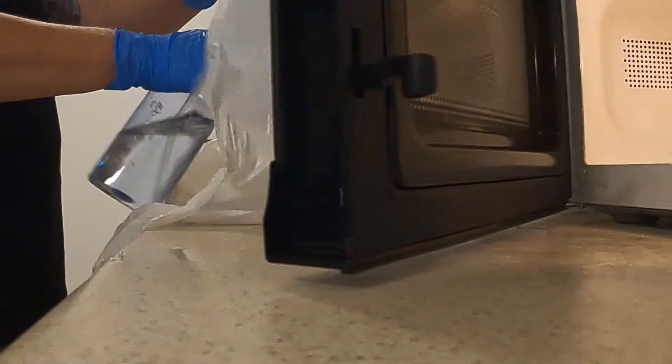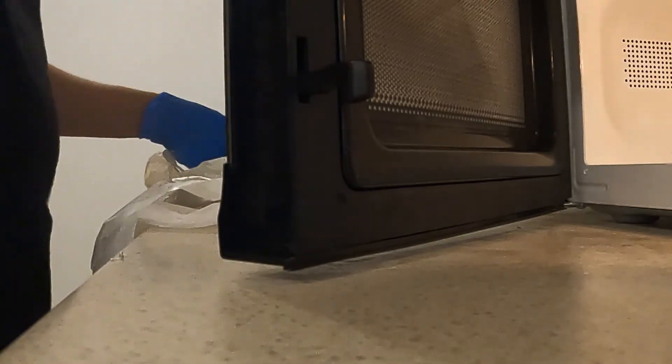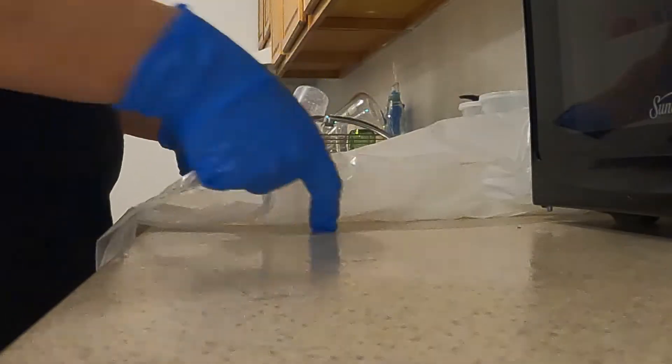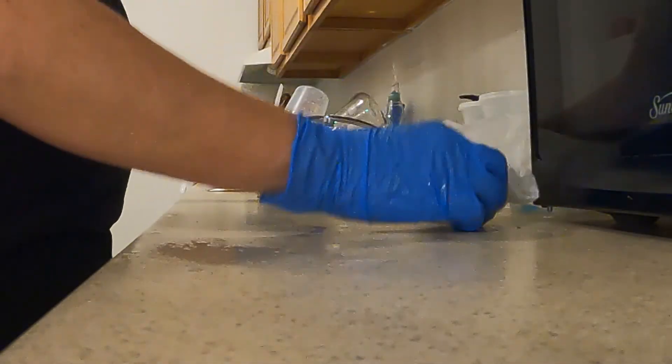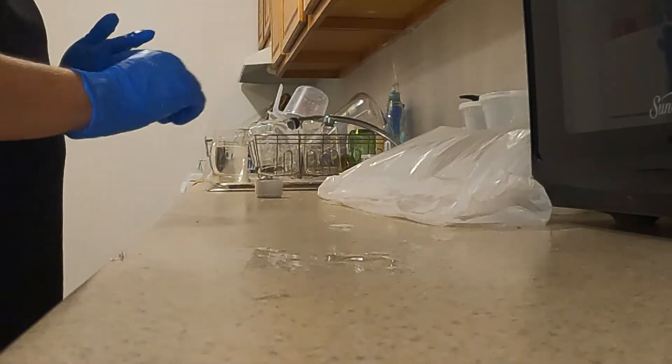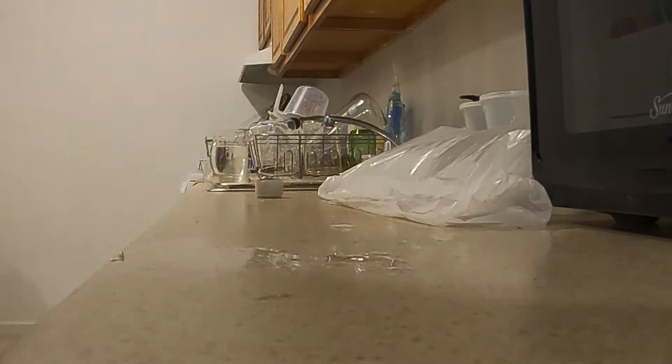I'm going to spray inside the garbage bag again. I'm going to fold in the top and kind of press it down and I'm going to set a timer for 10 minutes during which time it will cool.